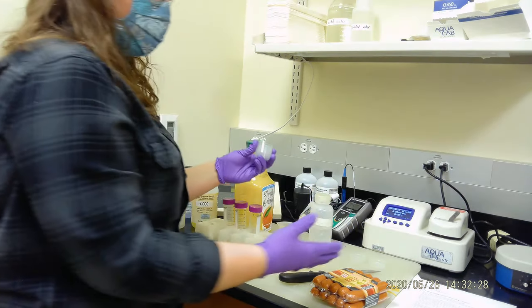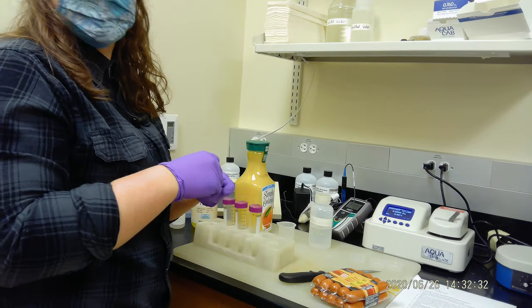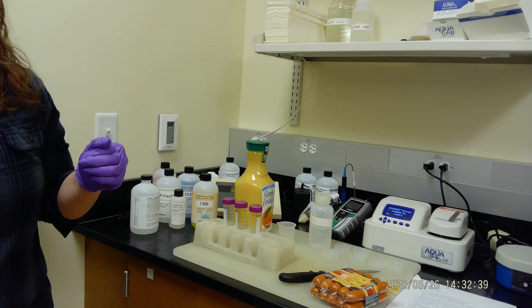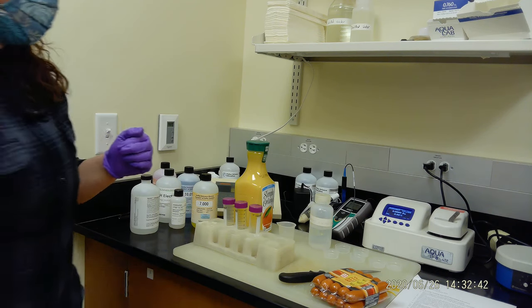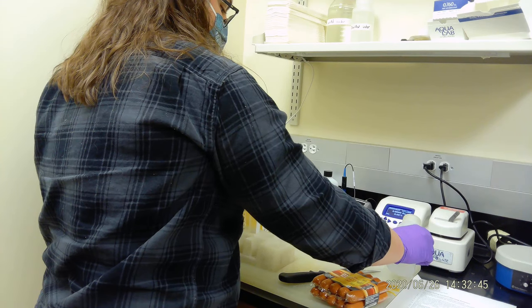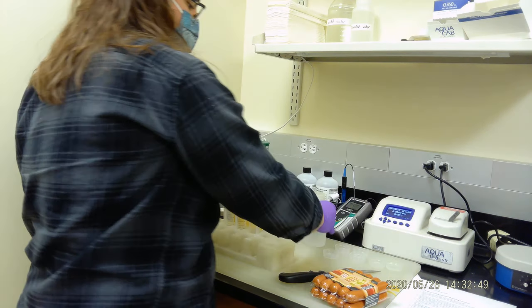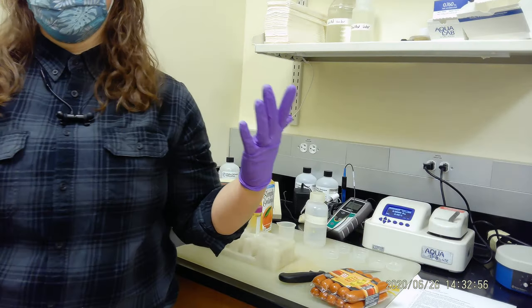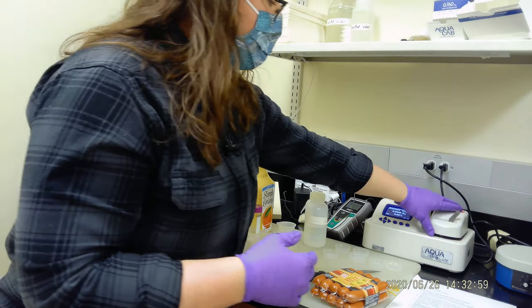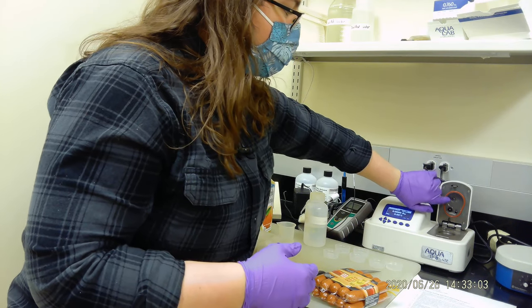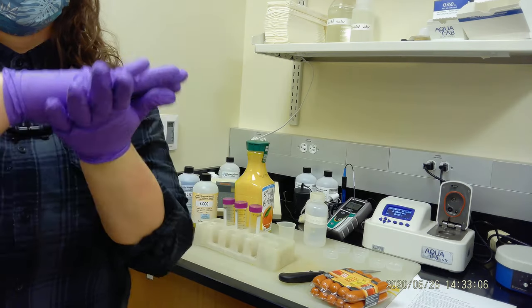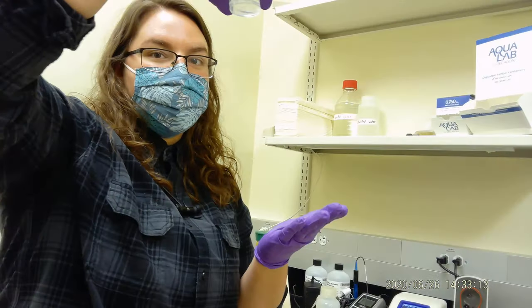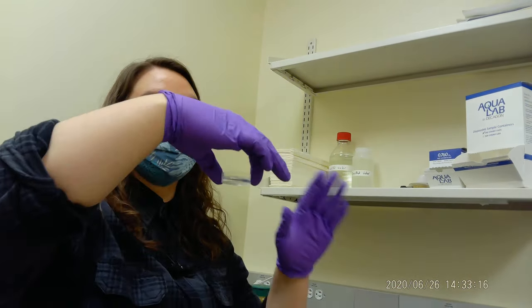Do you all know what water activity is a measurement of? What is it measuring in a product? Kim, what is water activity? It's like the free water that the bacteria use for growth. Yeah, that's fine, it's available water that can be used. The good definition is the vapor pressure of the water above the product surface. So this machine measures the humidity coming off of the product.